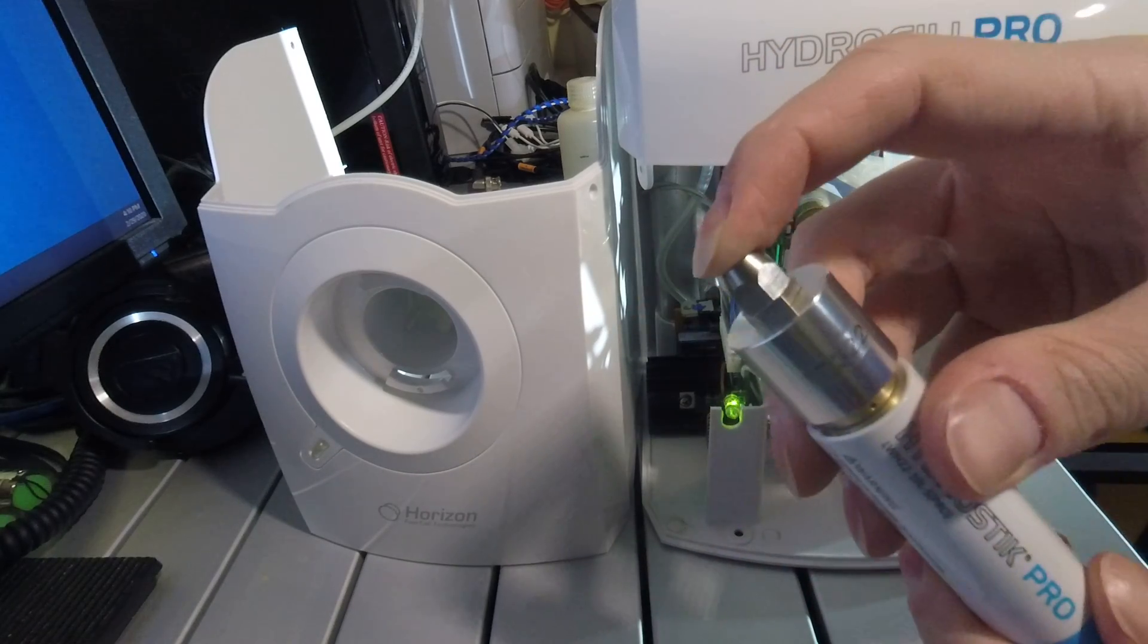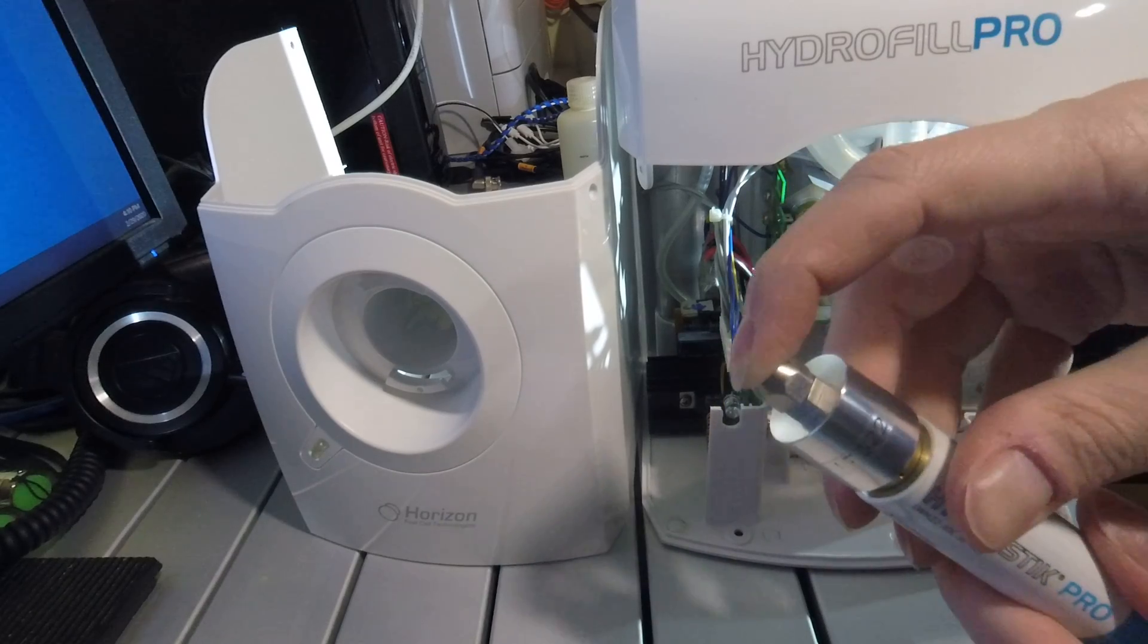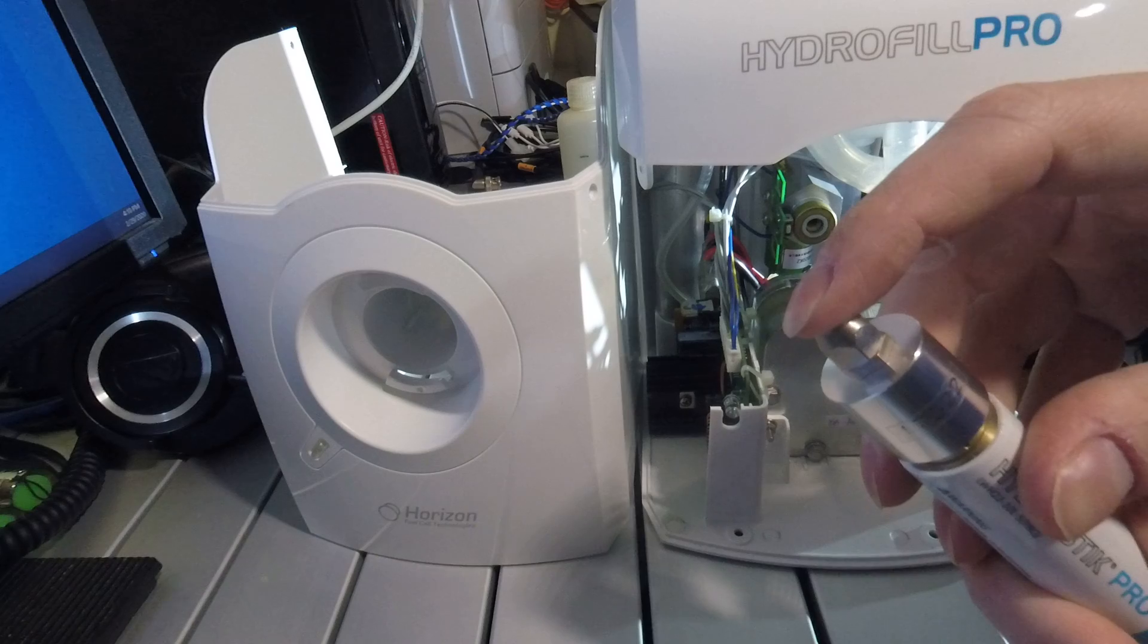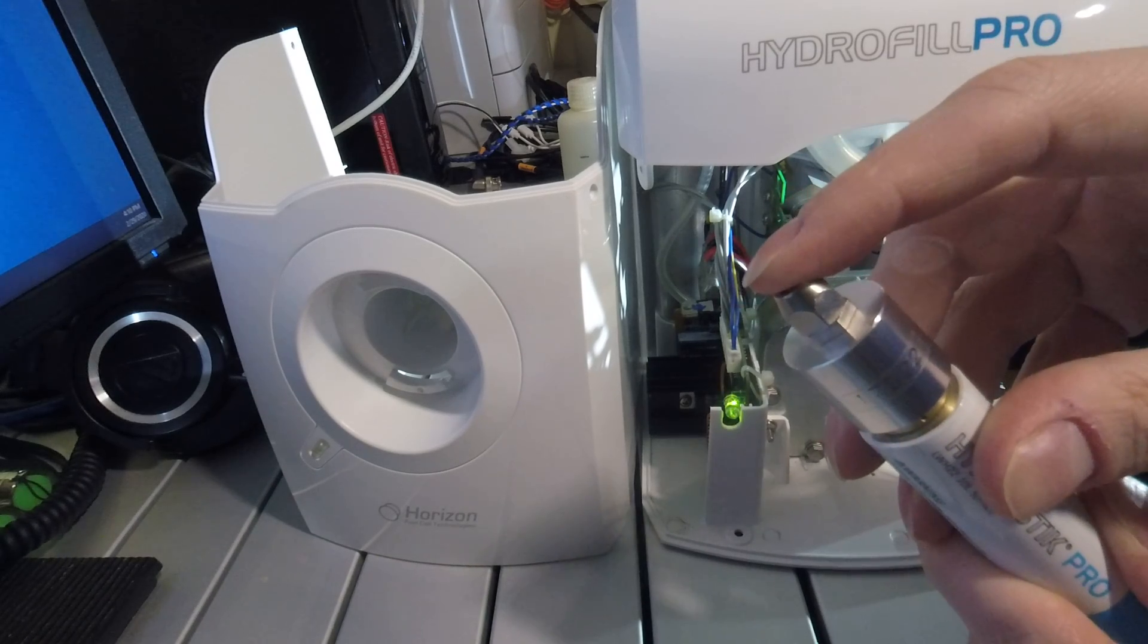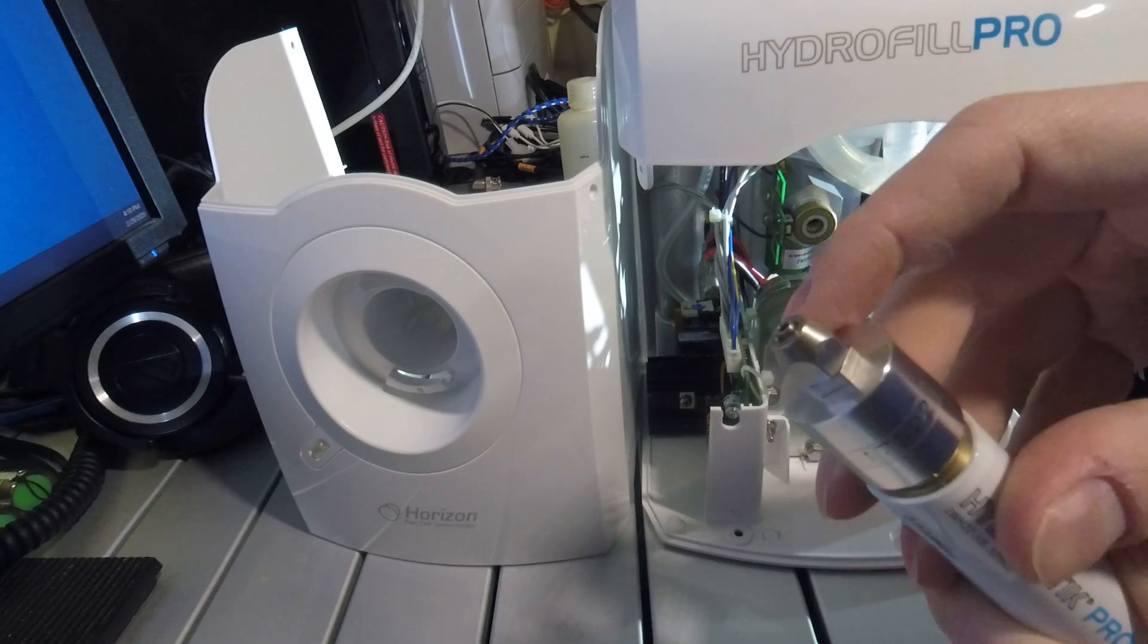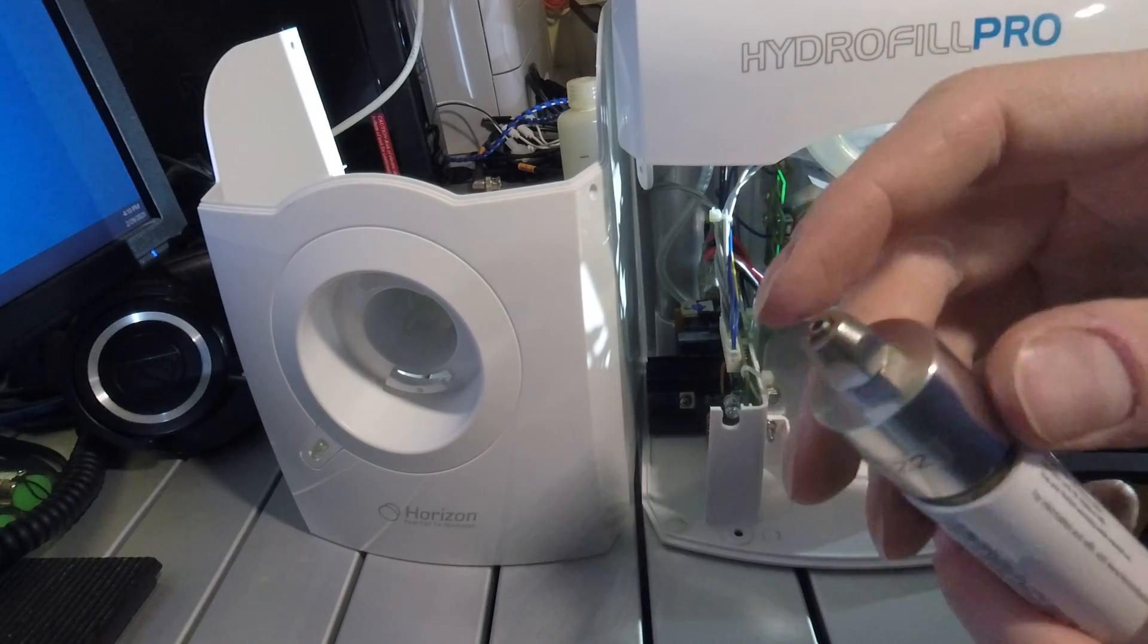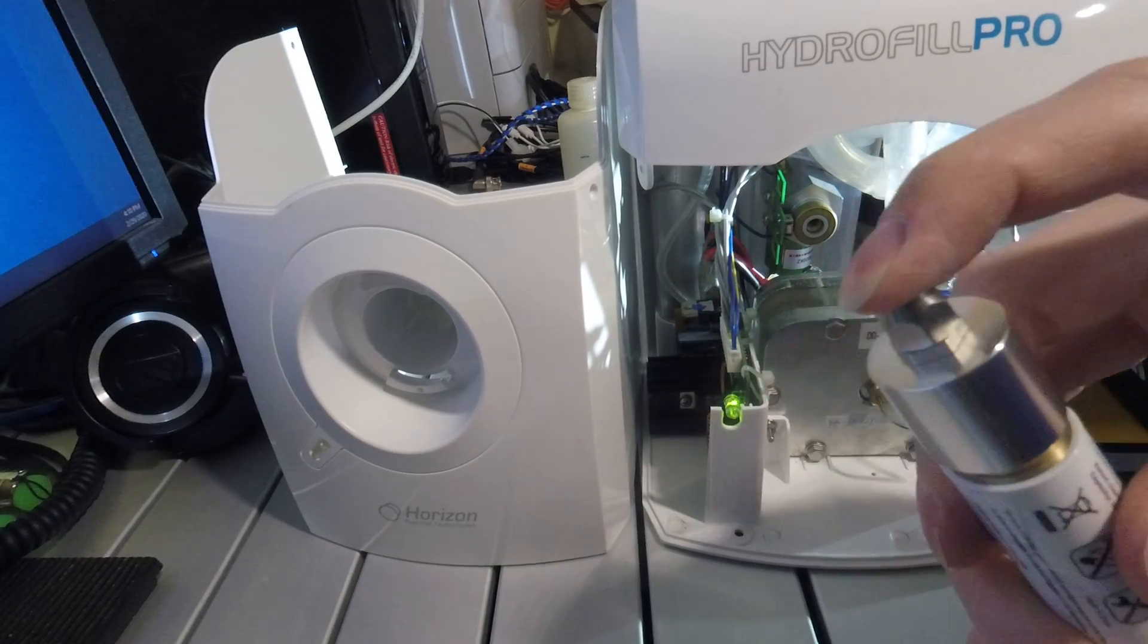It requires a back pressure to generate flow, so if you put your finger on it, it'll release some hydrogen, but then the minute you take it off, it'll stop. So you can kind of meter out the hydrogen. There's a very low flow coming through here, inconsequential, just to reset the fuse once back pressure is established.